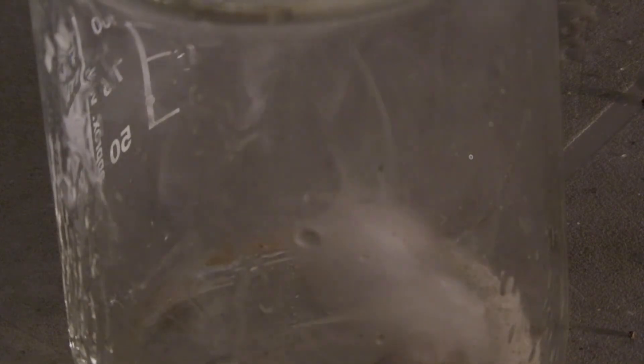Here it can be seen how violent even a few milligrams of sulfur trioxide react with water. The condition of the hose does show how well sulfur trioxide can oxidize organic compounds with water, which would also apply to ordinary grease.